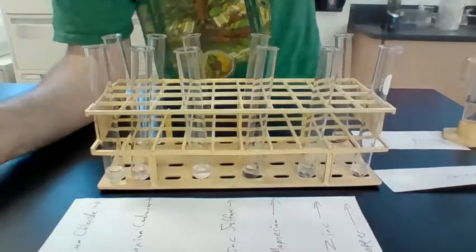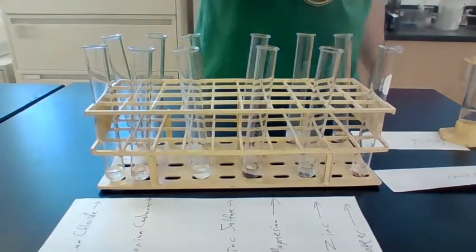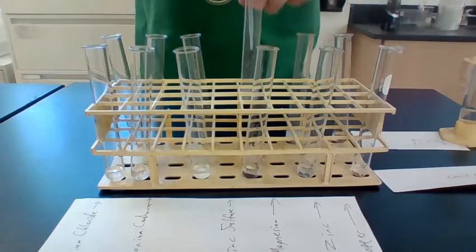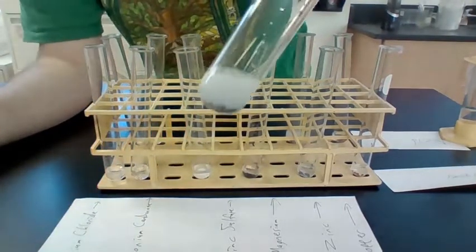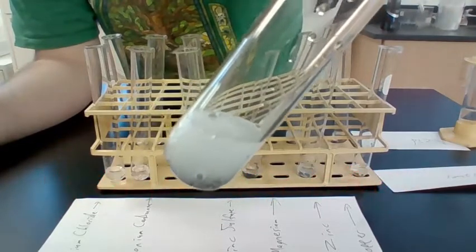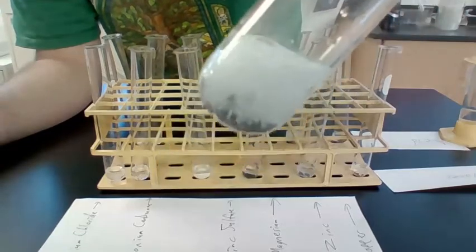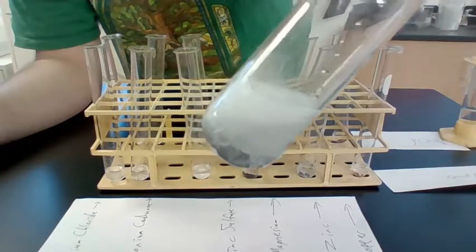This is definitely breaking down the zinc. If you can see bubbling, that indicates a chemical reaction.